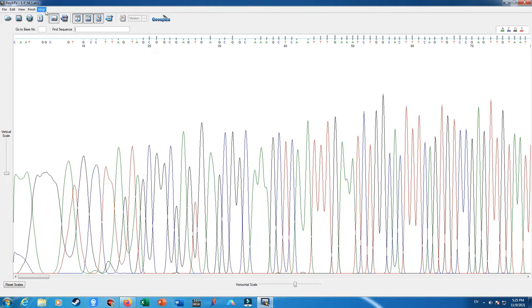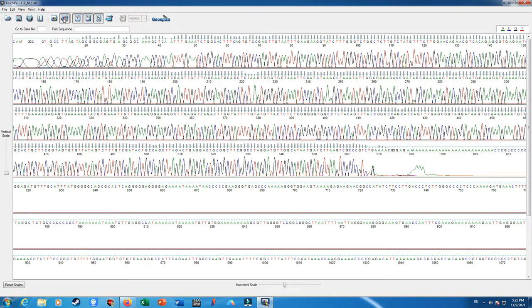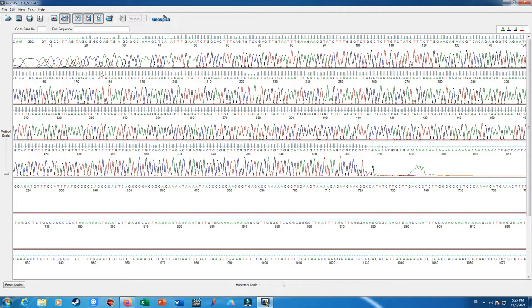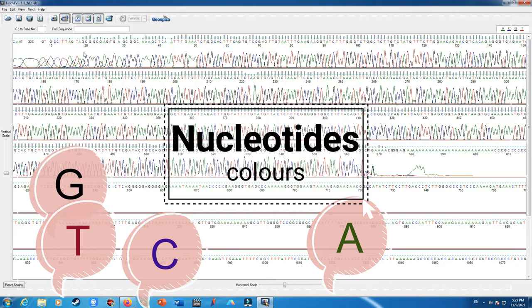This is the toolbar, and here we also have some tools like standard view and wrap view, which provide a good view of our sequencing data. Here I can also hide or show the positioning of the nucleotide sequences. I can also remove or show the sequencing result, I mean the base pairs, nucleotides. The nucleotides in the sequencing are always shown in four different colors: red for thymine. It's always the same in the sequencing results.